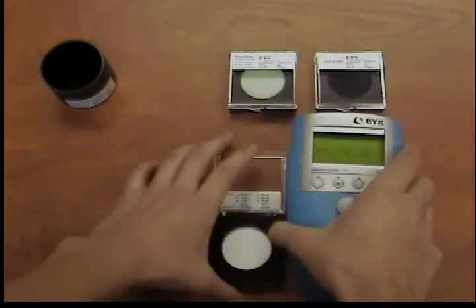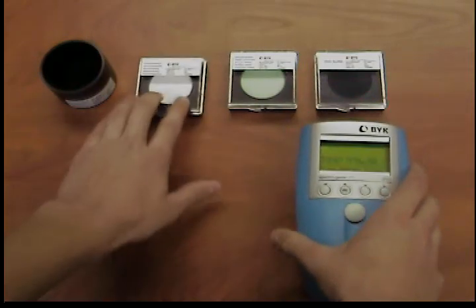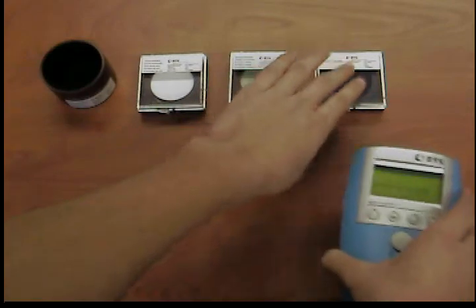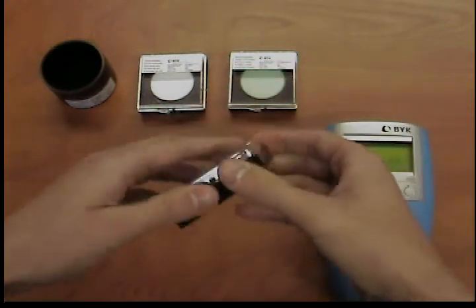For gloss calibration, place the high gloss standard with the indicated standard number under the device and press the operate button.